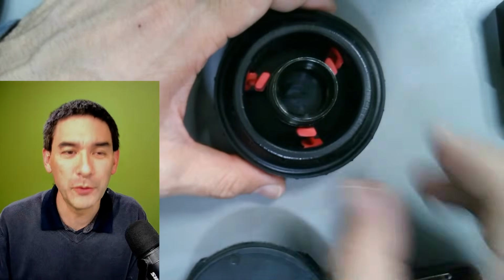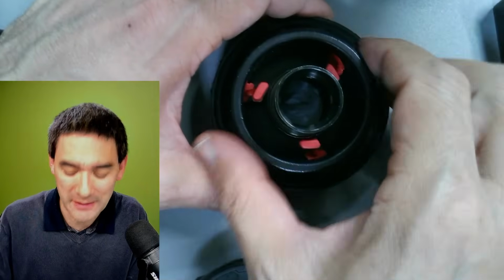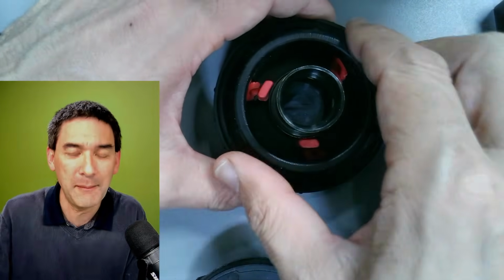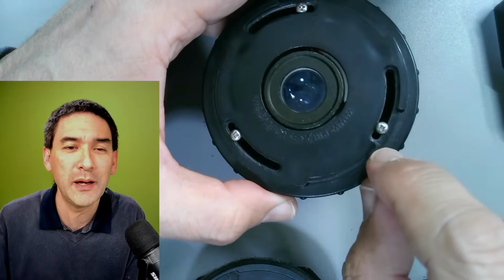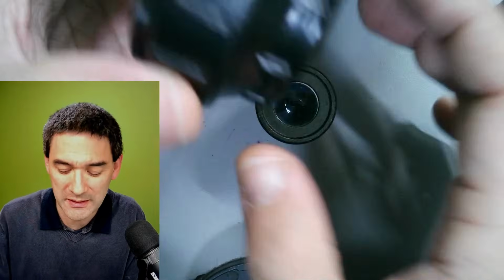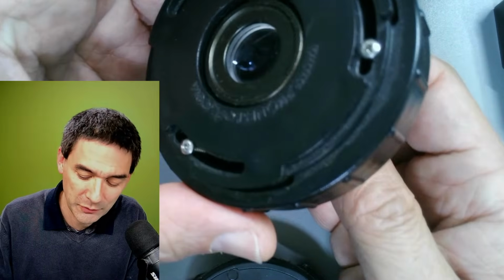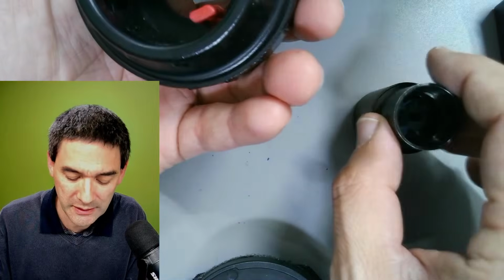Unfortunately, this is not entirely stable. And for this reason, you have to not only clamp it, but then you have to turn it around, and you have to use a screwdriver, and you have to tighten those three screws so that you can basically not turn it anymore, so that the eyepiece is clamped in place. I think I don't have to tell you that this is a very unstable solution, right?